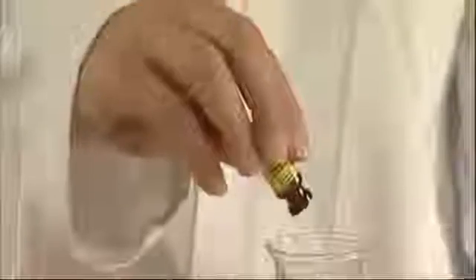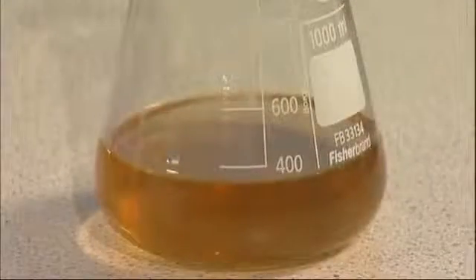After about an hour, the remaining agar will have cooled to about 50 Celsius, or cool enough so that you can touch the flask with your bare hand. Add the entire contents of the rehydrated ampicillin. It is very important to allow the remaining agar to cool before you add the ampicillin, or it will become inactivated. Swirl the flask to mix the contents.